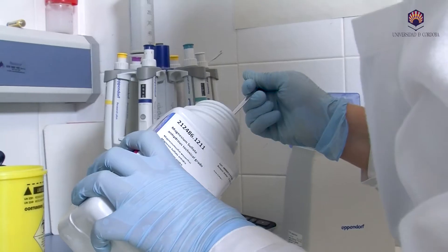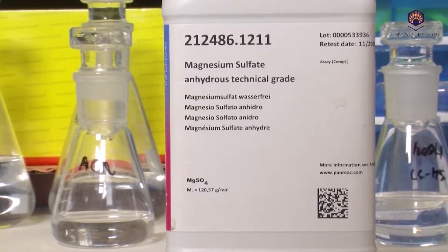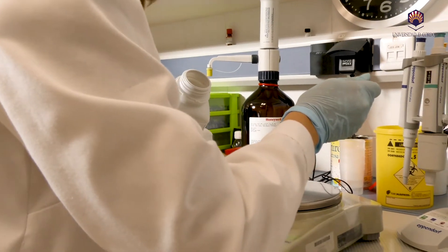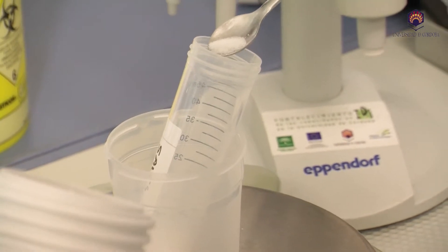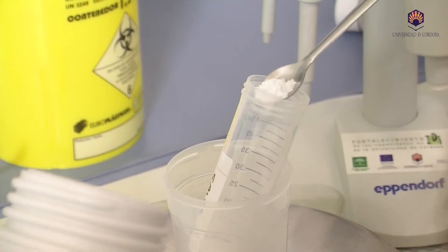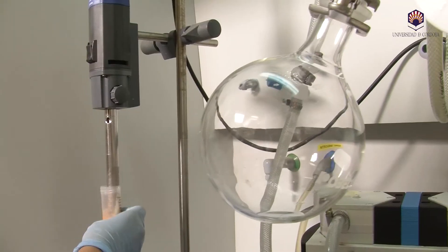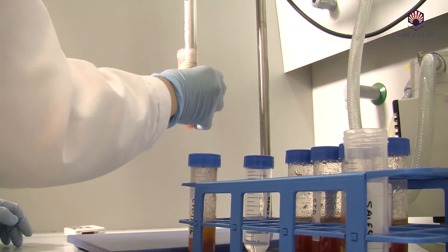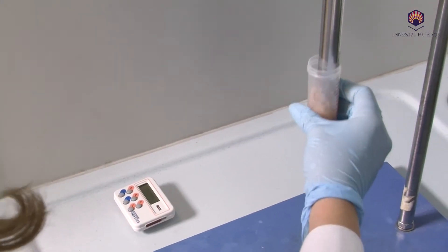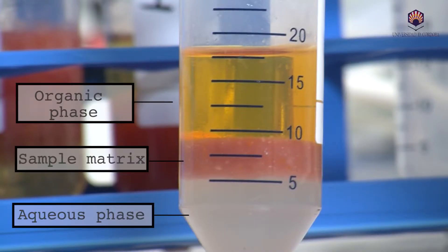In the pesticide extraction step, necessary salts are added such as magnesium sulfate, which improves the partition between phases; sodium chloride, which controls polarity favouring the extraction of pesticides from the matrix to the organic phase; and citrate salts, which adjust the pH to 5.5 to extract all pesticides both acidic and alkaline. To improve the extraction of pesticides from the organic phase, UltraTurrax is used for one minute to allow for cell disruption. Next, we centrifuge the sample tubes at 3000 rpm for the correct separation of the phases.